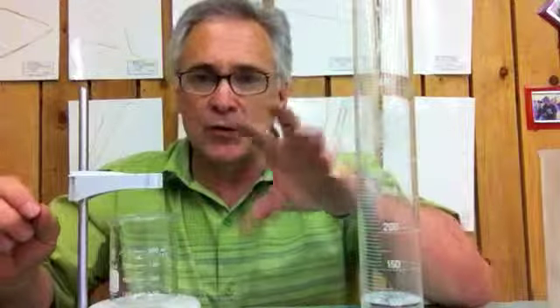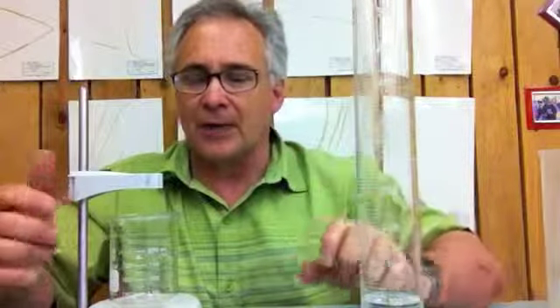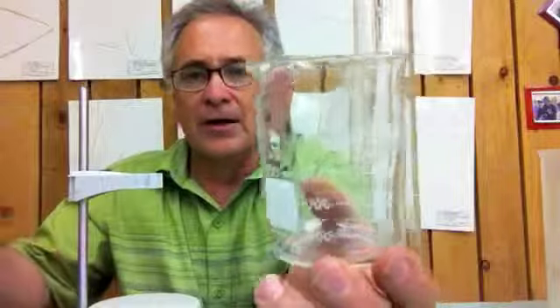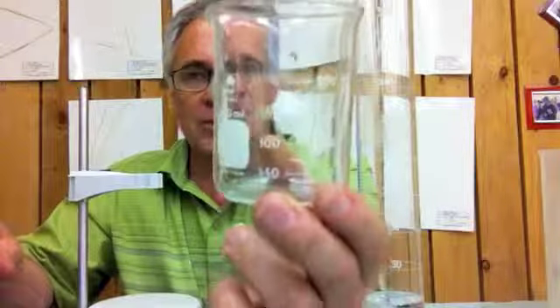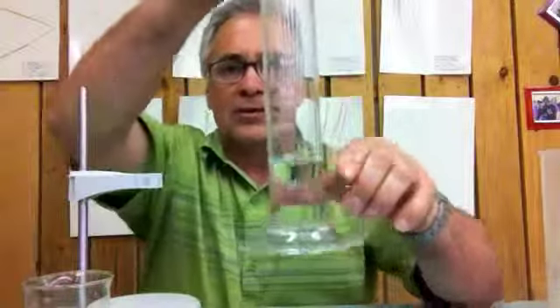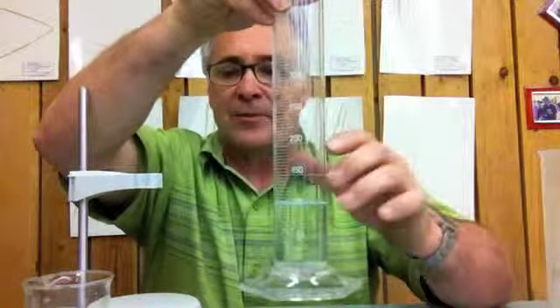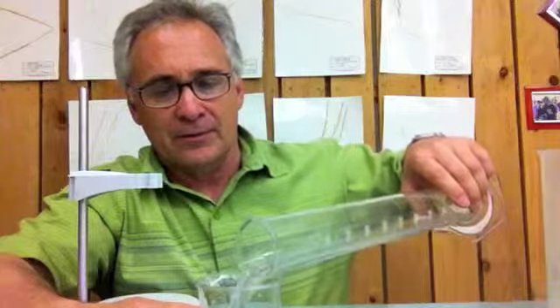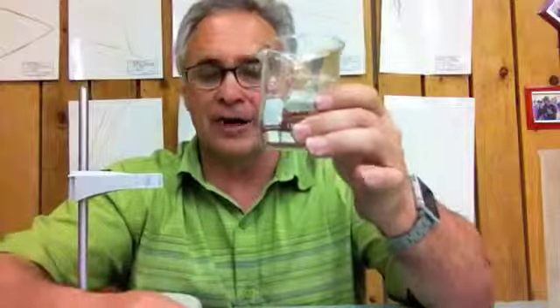So when you're reading through all of the directions in this lab as you get your data loggers, you're going to be measuring out 100 mLs of water. Now I don't want you to take this beaker to the sink and just fill it up. What I want you to do is use the graduated cylinder. That way, by using the meniscus, we can get an exact amount. This isn't very accurate. This is accurate. So we're going to go ahead and pour that 100 mLs of water right into there. We're going to use a 200 ml beaker, get 100 mLs of water.